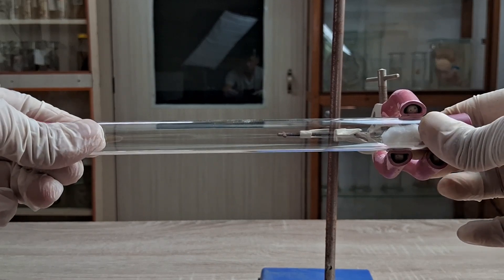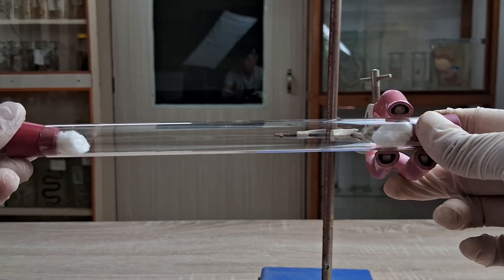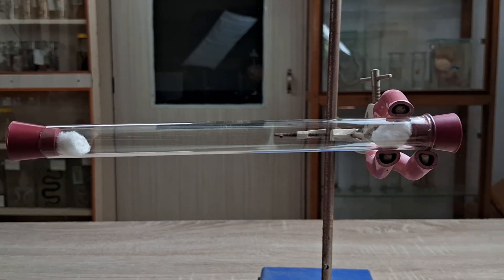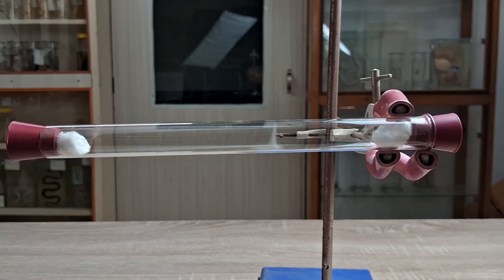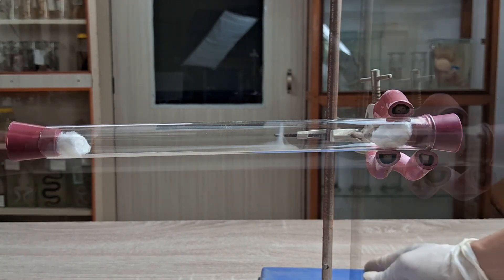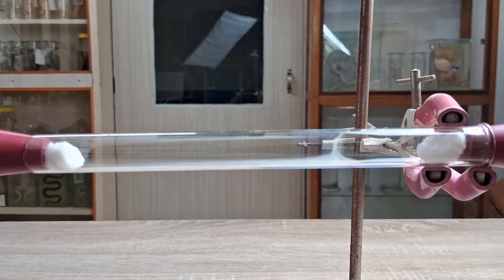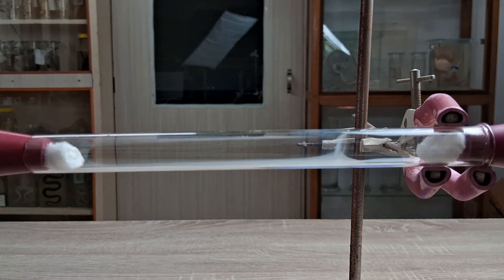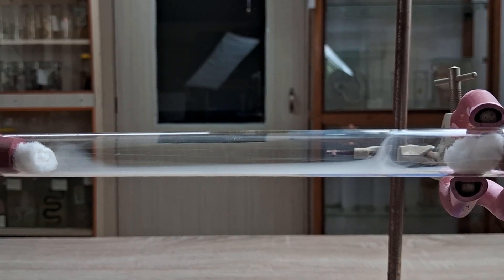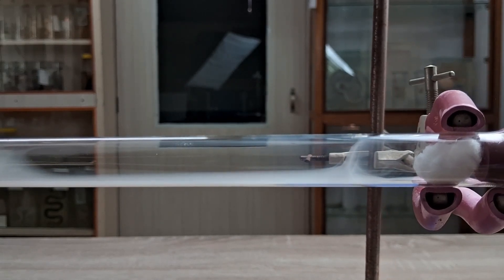As soon as you introduce the two cotton balls into the tube and secure the rubber stoppers, you will observe a thin white cloud ring starting to form somewhere towards the cotton ball dipped in hydrochloric acid. As the reaction progresses, this cloud ring increases in area, travels closer to the hydrochloric acid cotton ball, and eventually begins to spread throughout the inside of the tube. The white fumes are more concentrated towards the hydrochloric acid side because the fumes of ammonia are lighter than those of hydrochloric acid and therefore travel comparatively faster towards the hydrochloric acid. The fast-moving ammonia fumes also create an air current, bringing about a beautiful circular convection flow in the white cloud that is formed.